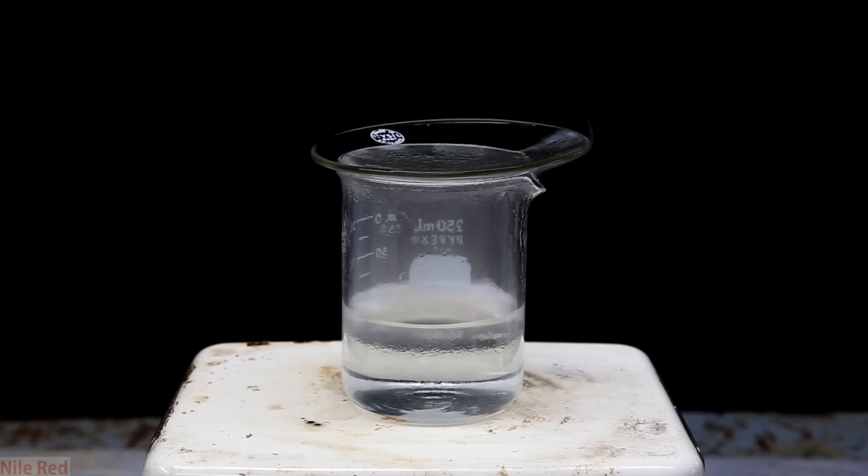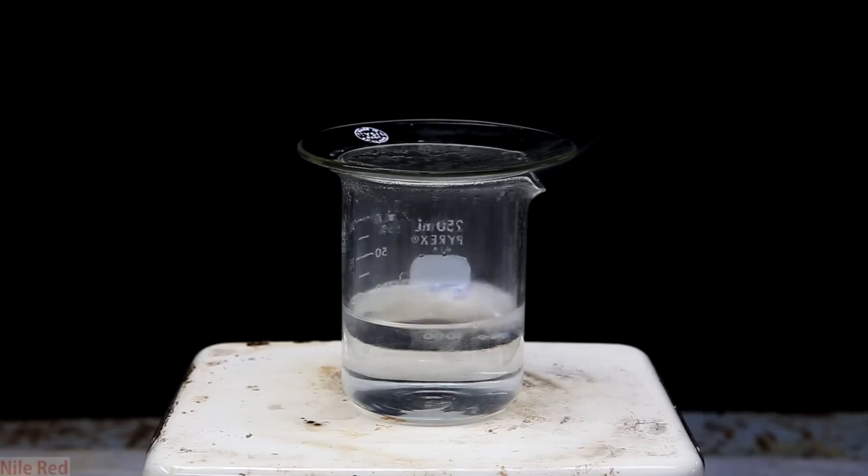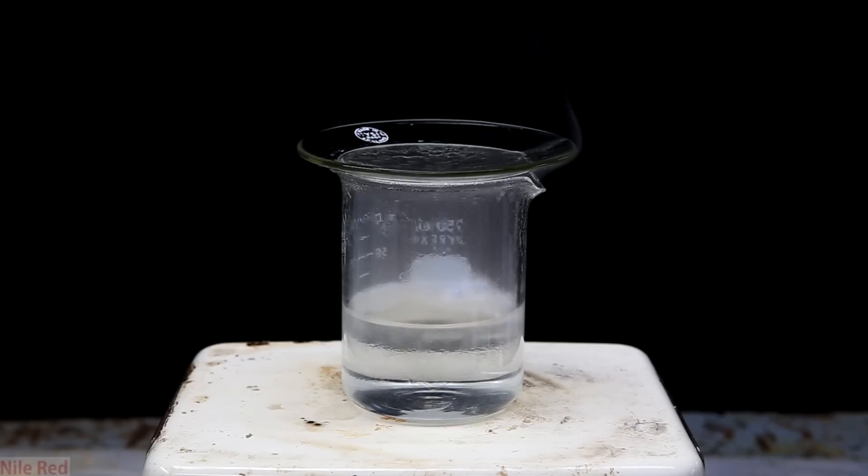At some point, I was concerned that if too much lithium was added, it could lead to a violently boiling runaway reaction. So I really strongly considered cooling it, but I found out later that that's not really that necessary. What I found interesting was that the temperature that the water achieved kind of peaked out much below the boiling point. The reason for this is something that I actually didn't predict.